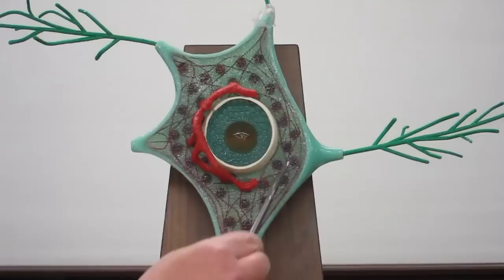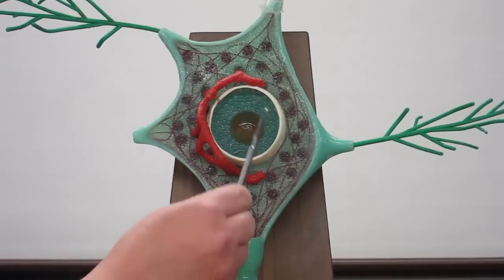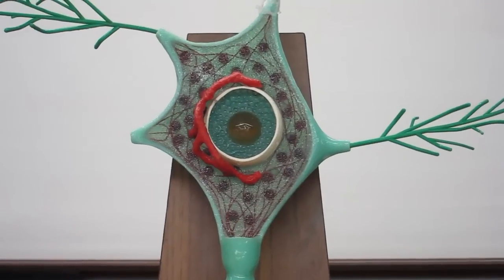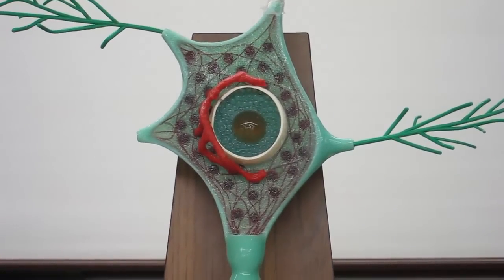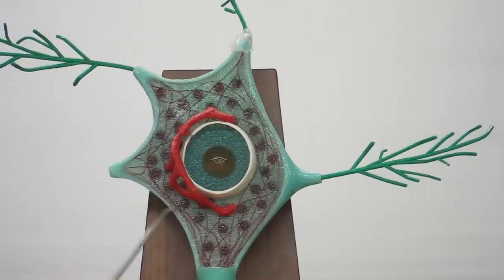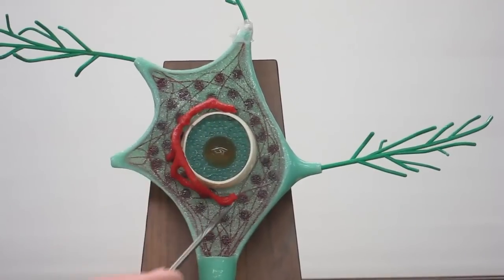This section that has the nucleus in it is the cell body, and you can see the nucleus here. This red material is a representation of the rough endoplasmic reticulum, which has a special name in neurons: the Nissl bodies. You may have heard that in lecture. You can also see other organelles and cytoskeletal structures in here as well.